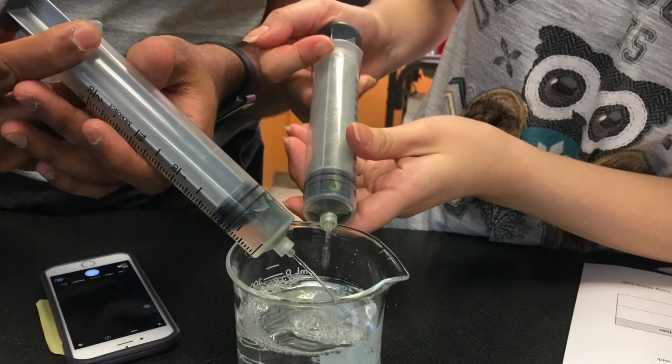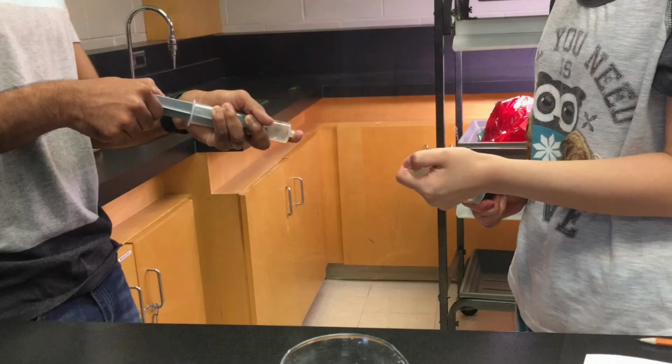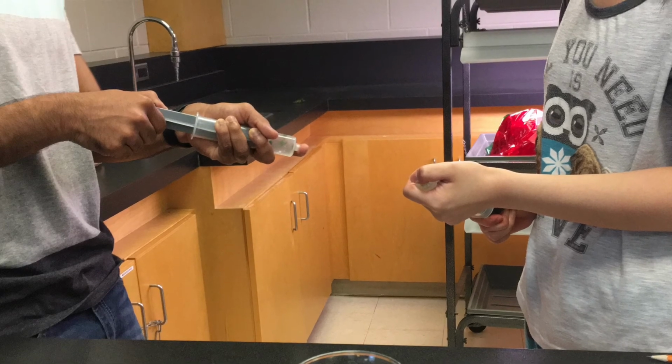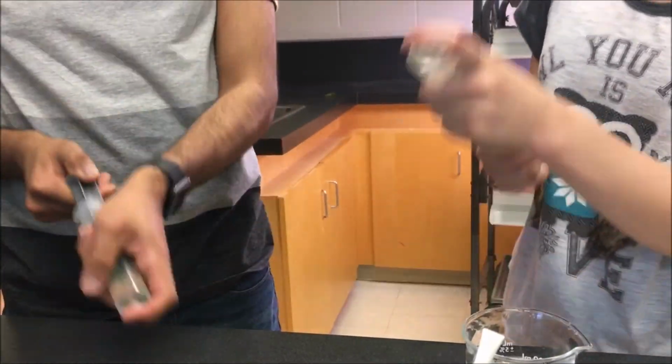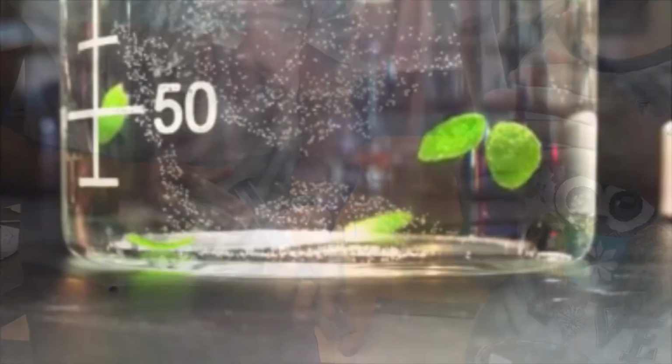For this lab in particular, one obstacle that was faced was that we overlooked the importance of the solution the leaf discs were suspended in. We were expecting to have 0 leaf discs float in our control experiment and were unpleasantly surprised when more than one did. So really, for that experiment, it should have been suspended in just water and soap.